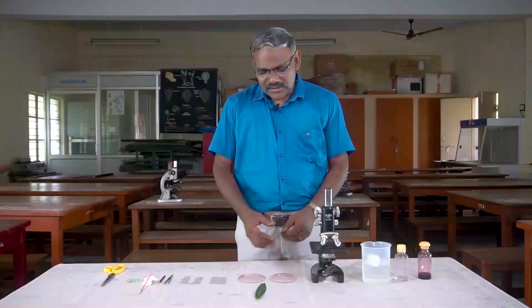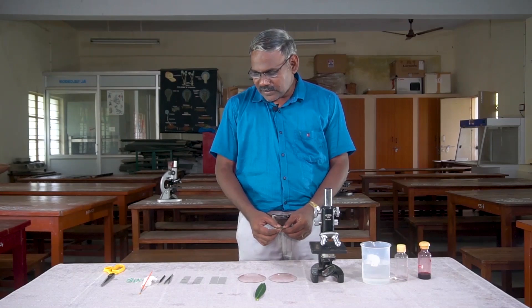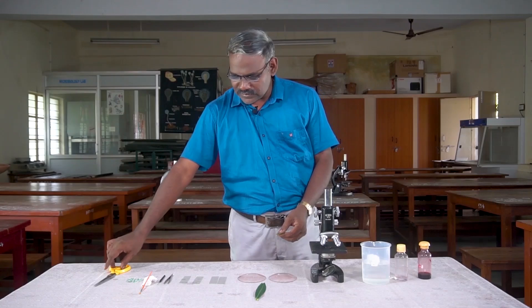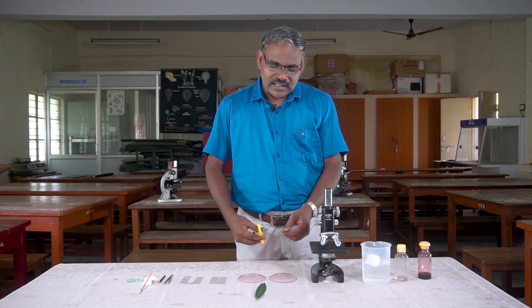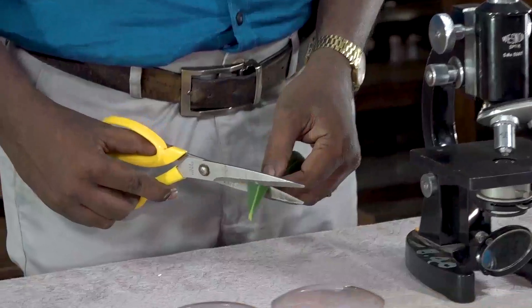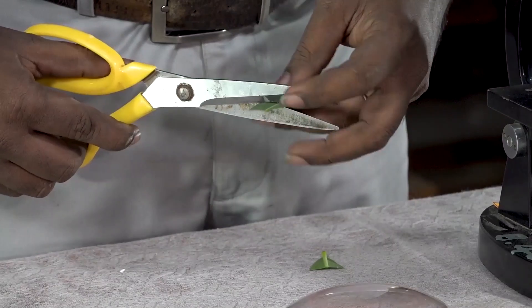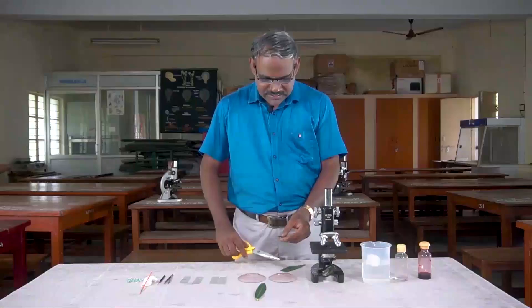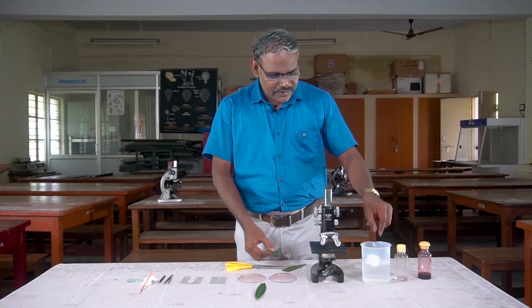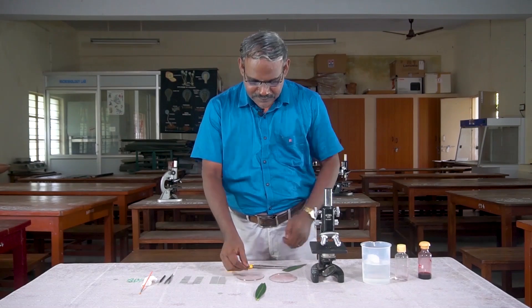We can put a mature leaf. We can cut the section. Cut the section and it will be ready. Cut the section into the glass.